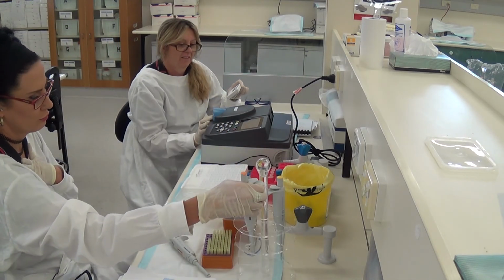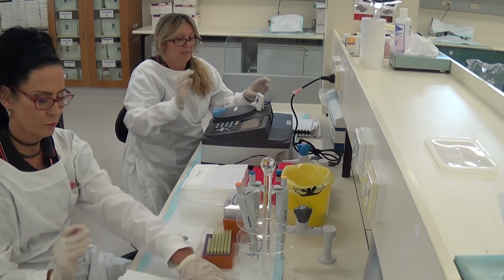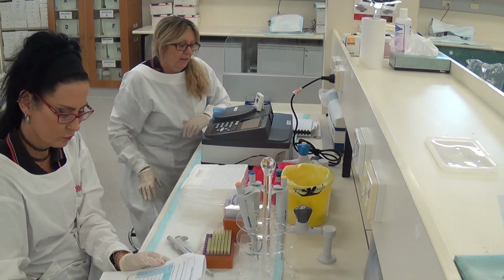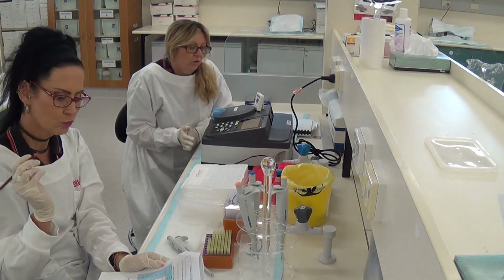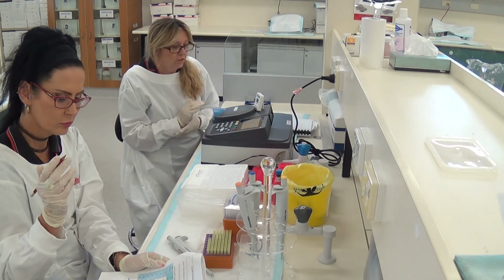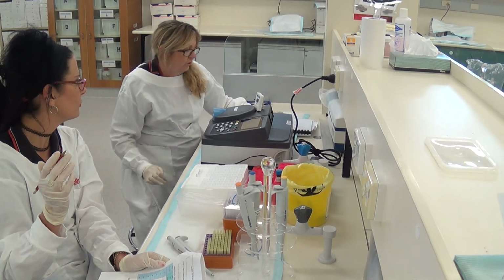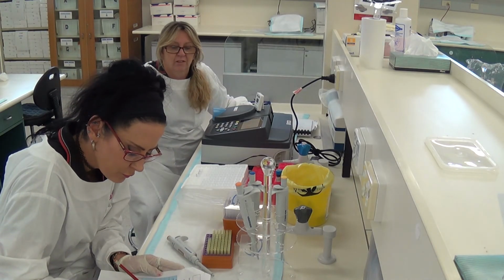Sweet. Okay, so now we're going to set the timer again. We're already up to 17 seconds. And we're going to record it at the 30-second mark. So hopefully we're going to see a trend start to occur as we record these times. So the first one is 0.197 at 30 seconds.